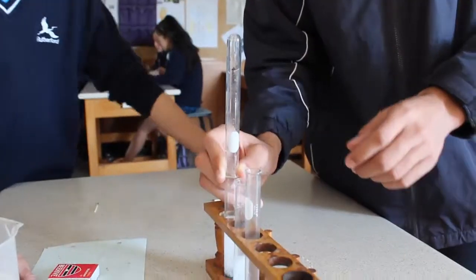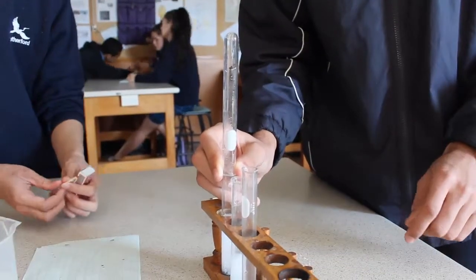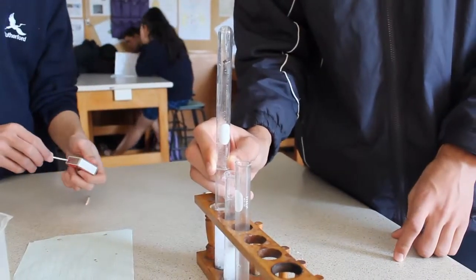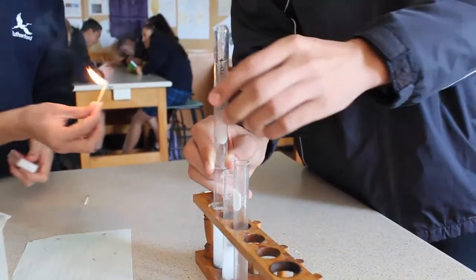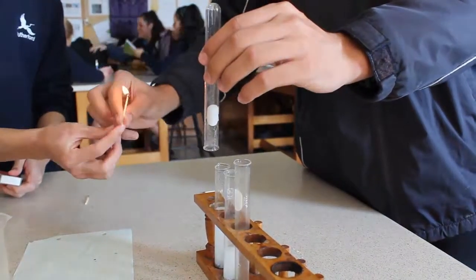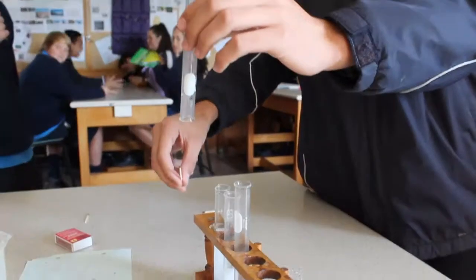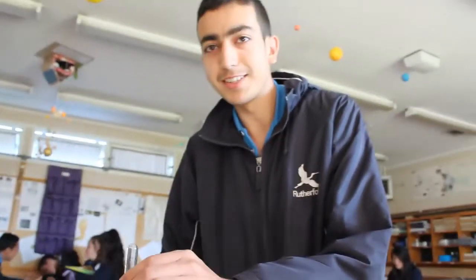What a fail. Okay, now we're going to light the match and see if we've got enough hydrogen to create that popping noise. And that is the pop test. Thank you.